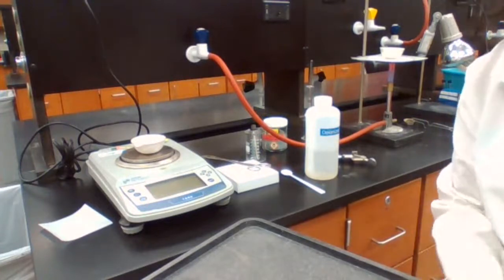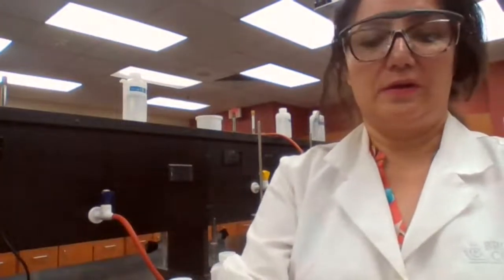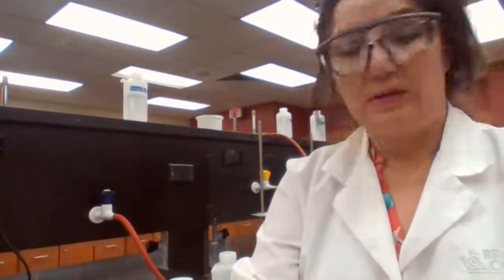It's going to go to part E for part 1. If I don't say it's part 2, it's part of part 1, but since I already brought part 1 into the data part, I'm going to specify part 1, letter E, and the mass is 40.642 grams.